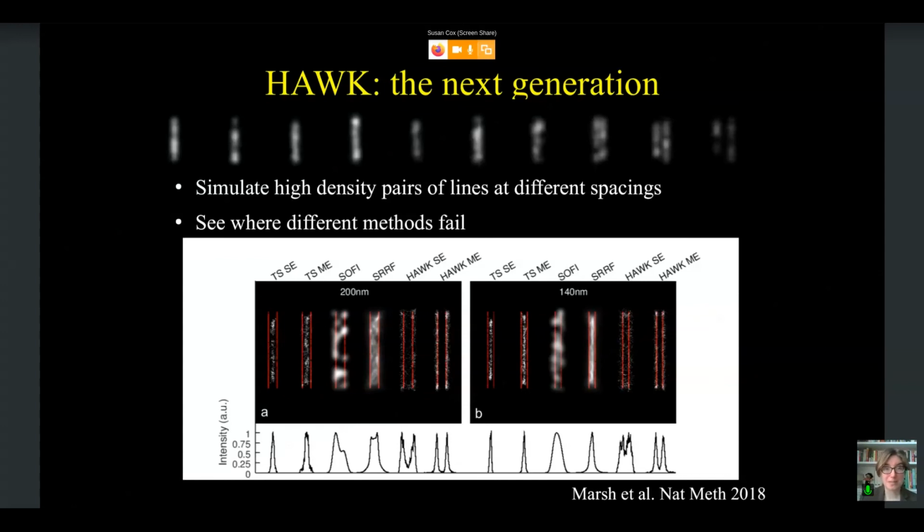analysis methods. And here I'm showing 2 examples. The first that I've shown you a bit of already at 200 nanometers separation, and the second at 140 nanometer separation, just to give you an idea of what it looks like at the different separations. And you can see that when we use Hawk with both the single emitter and the multi-emitter, here I'm using Thunderstorm, fits, and those are the last 2 pairs of lines to the right in each set, you can see we get back that separation.